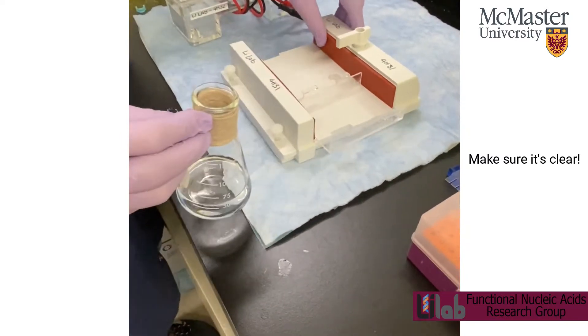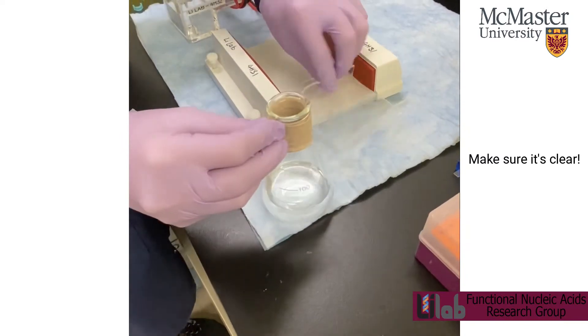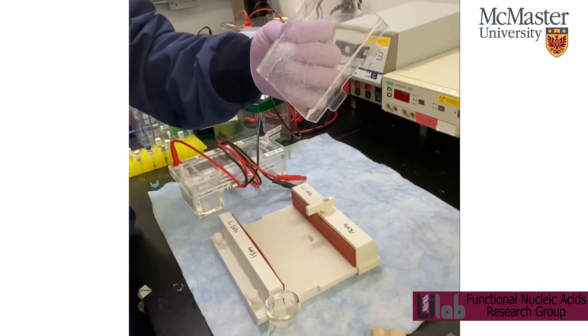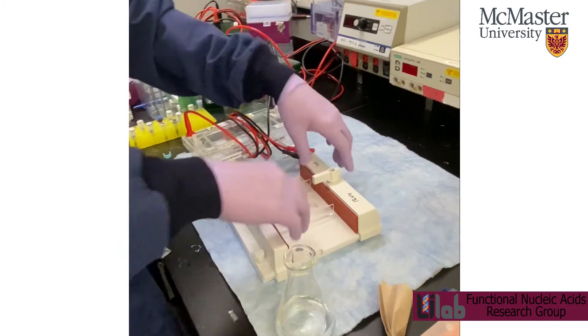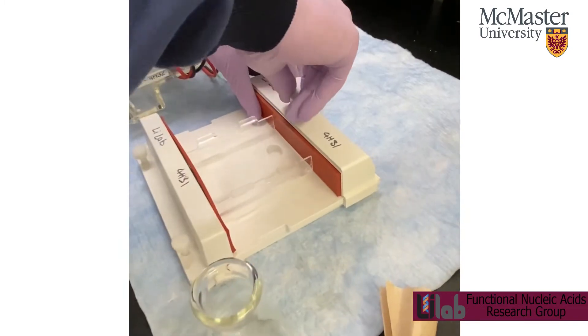So grab one of these casting apparatuses and the gel mold holder. And then you can just put it in here and tighten it.